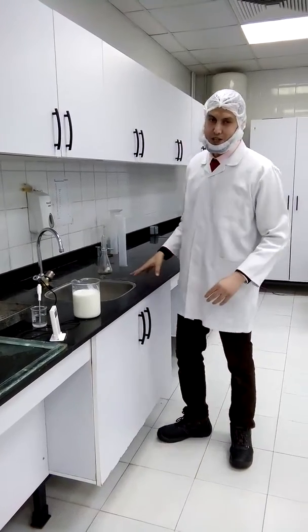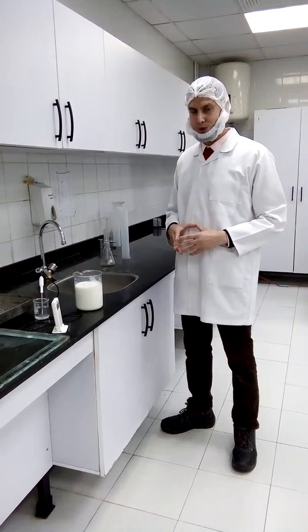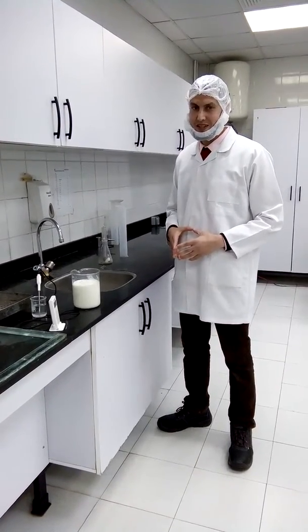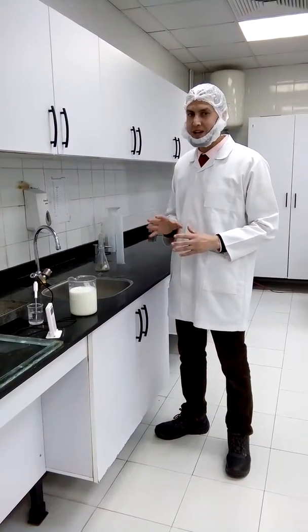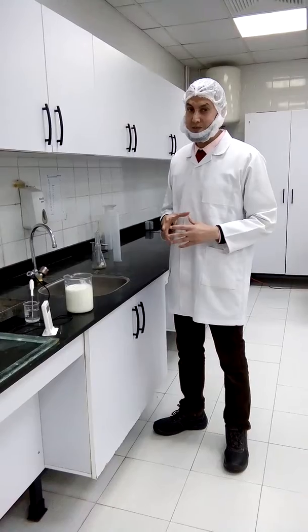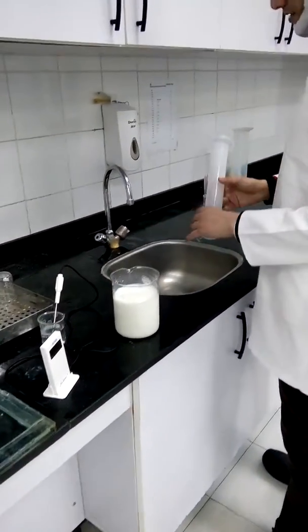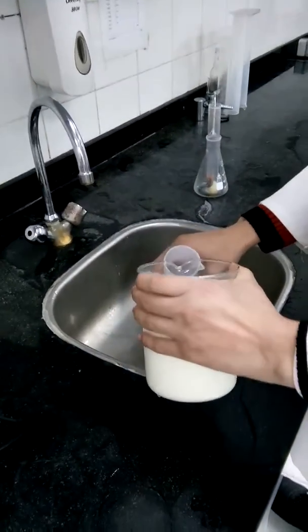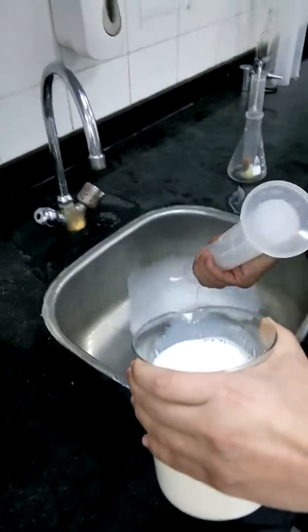Milk densities range from 1.028 to 1.036, and this range refers to the type of milk — for cream milk, whole milk, skim milk, or skimmed milk. Now I will put our sample in and remove any excess water.